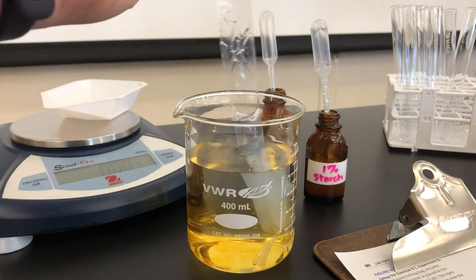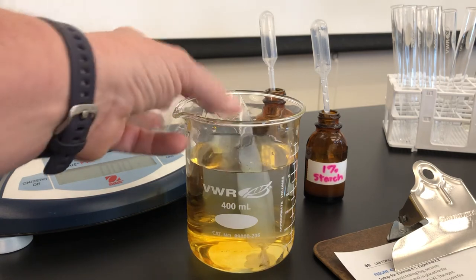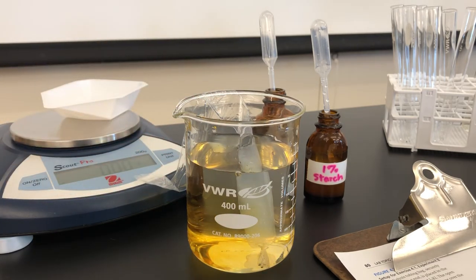We're now going to let these soak. And this membrane, if it allows molecules to move through, we can track whether diffusion and osmosis are taking place.